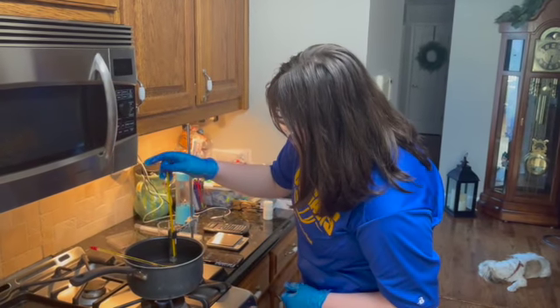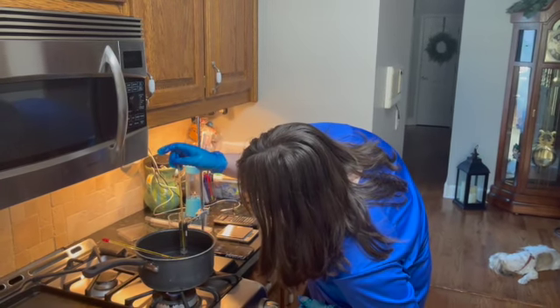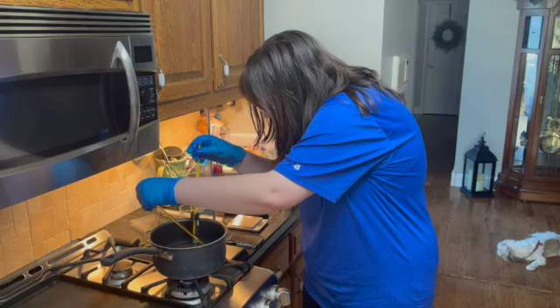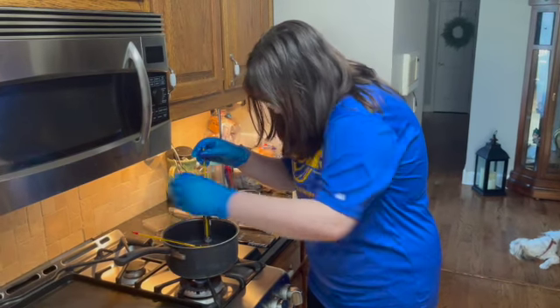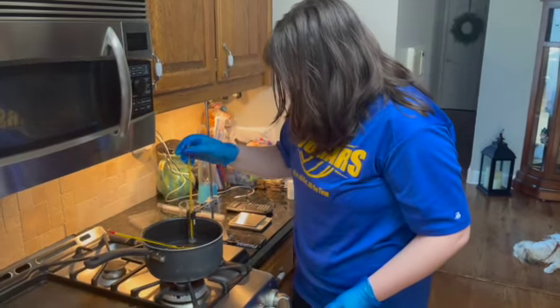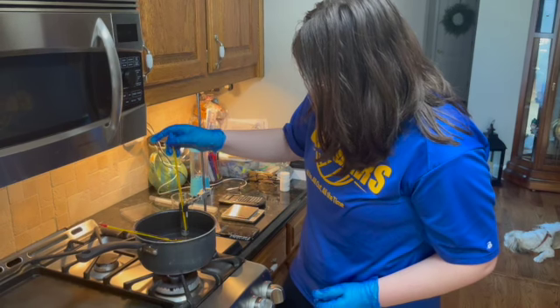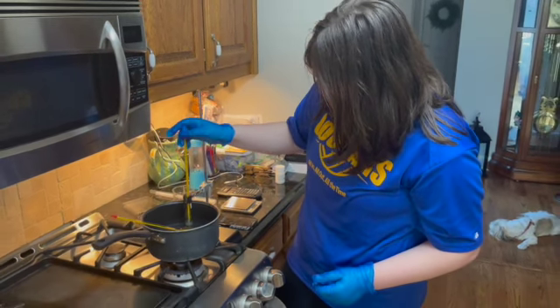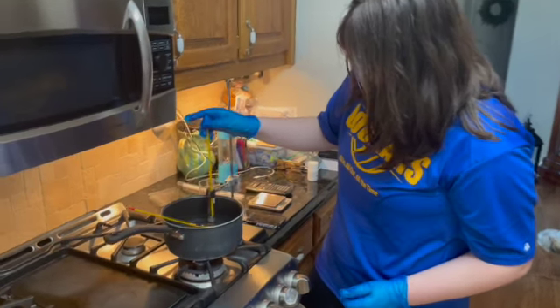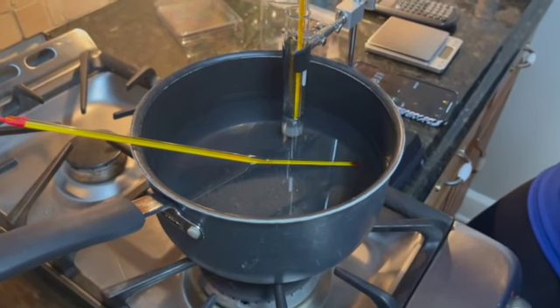Okay, so we're at the 8-minute mark, and our solvent is at 52 degrees Celsius, and our hot bath is at around 55 degrees Celsius. So I'm going to bring it down just a little bit, bring it more to a simmer on this hot bath. So a lot more of it is liquidated than it was just previously. It has melted down pretty much, I would say maybe around 80% melted at this point.